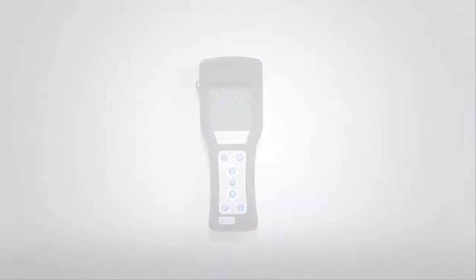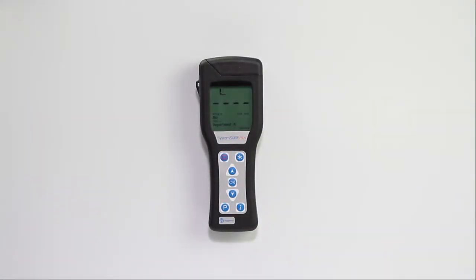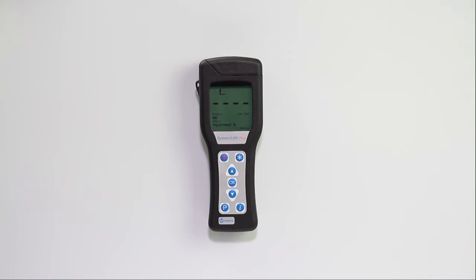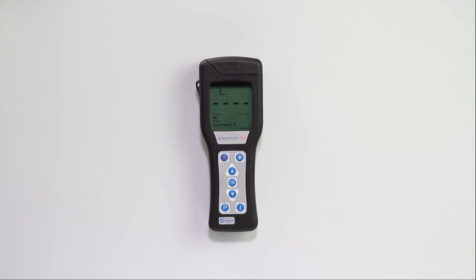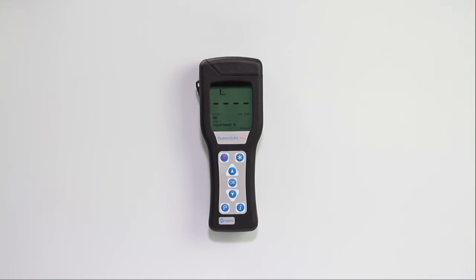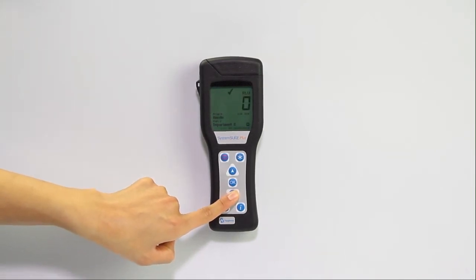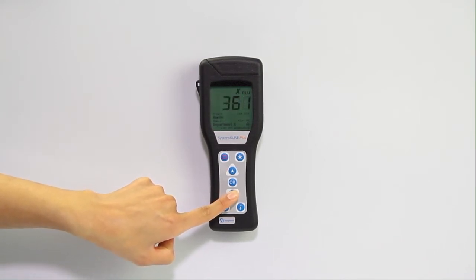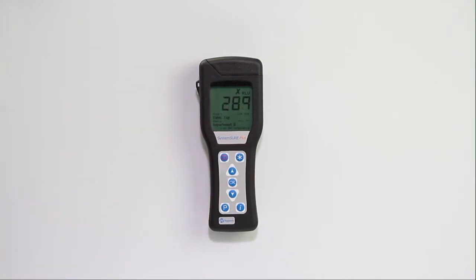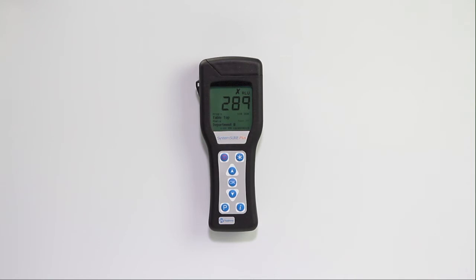To perform a retest, begin at the test ready screen. Then use the down arrow to navigate to the failed result of a test location. For example, if you are going to retest the tabletop in Department B, navigate to the tabletop's failed result.